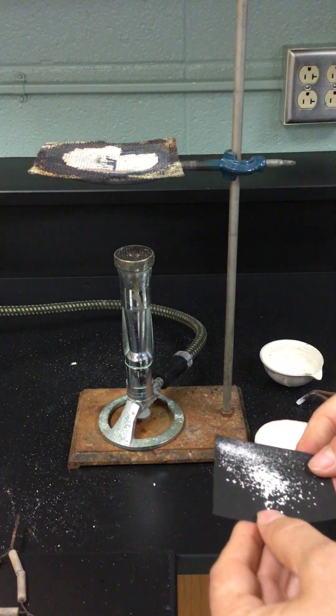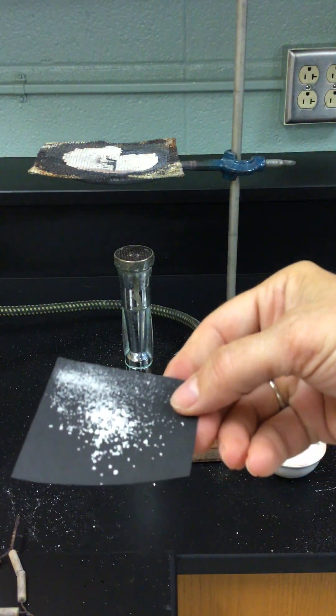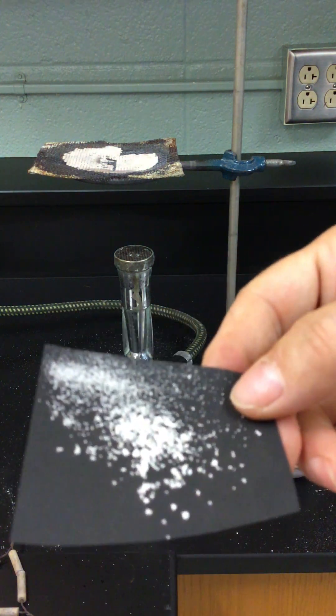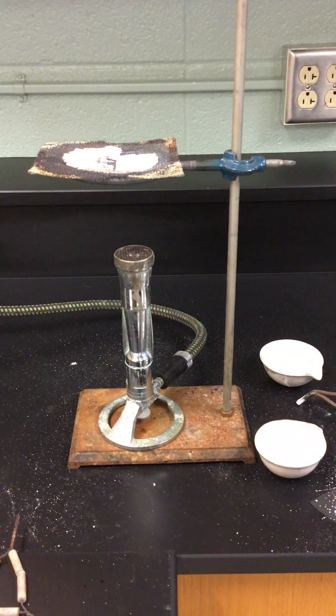Oh my gosh, what could that possibly be? That's what's in our evaporating dish. Okay, finally we're done with this part. Oh my gosh, what's in our evaporating dish?